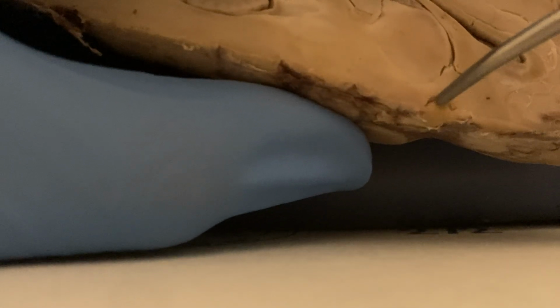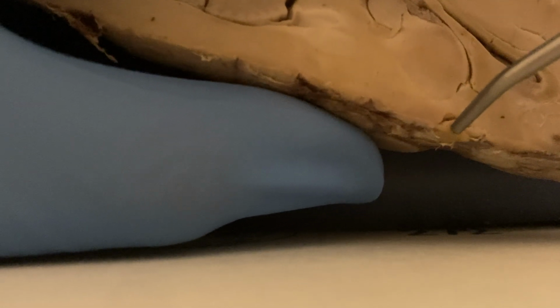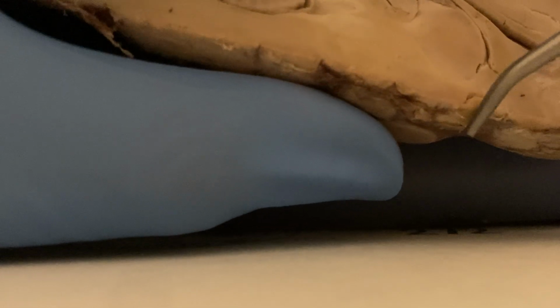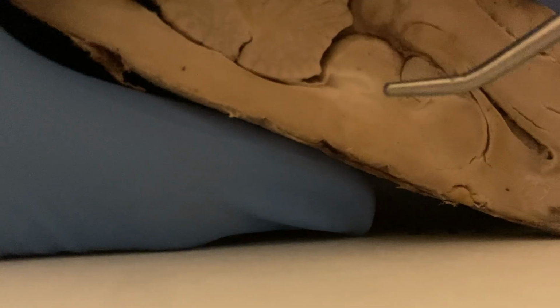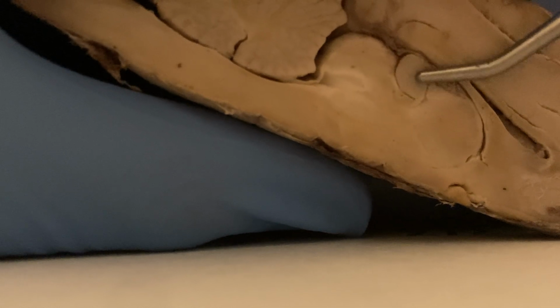The optic chiasm, I believe I was able to find that here, which allows the left and right hemisphere to receive sensory input from the optic nerve of the left or right eye. So both hemispheres of the brain can interpret messages from either eye. The pineal body, I believe I was able to find here. The pineal gland, some functions being unknown, but mostly it helps us sleep by producing melatonin.